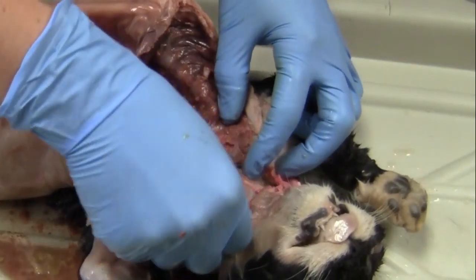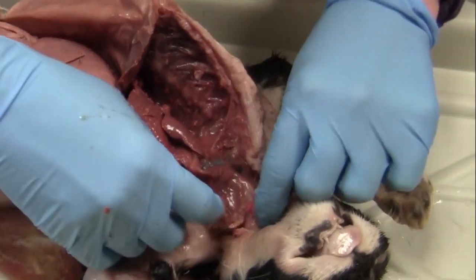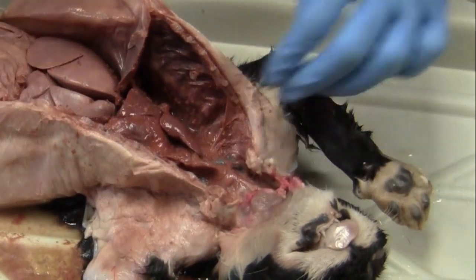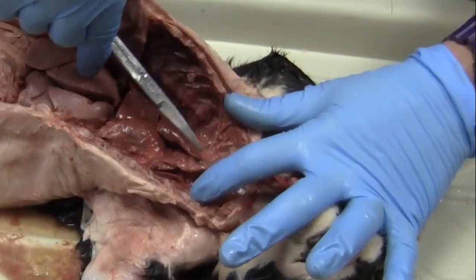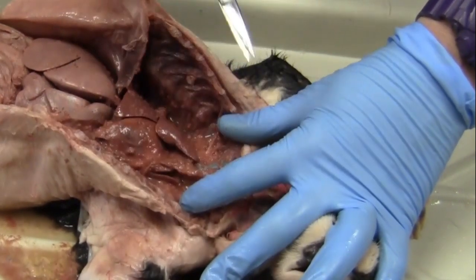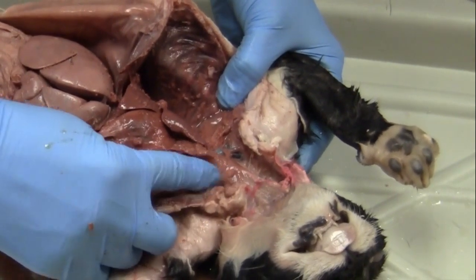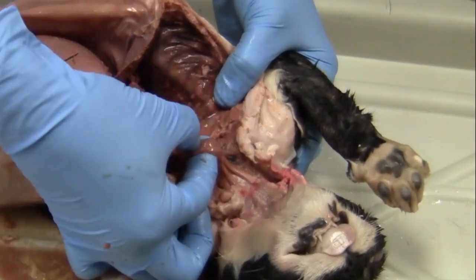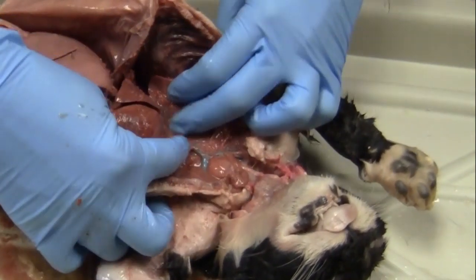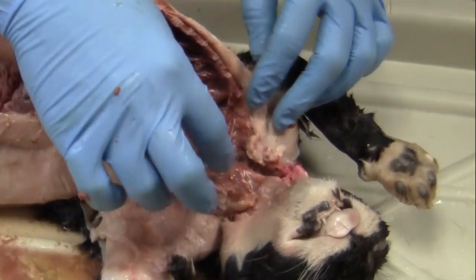Okay. So also when you're doing these, you can see I'm using a lot of my fingers for a lot of this stuff. You want to try and preserve as much of the tissue as you can. So using blunt dissection, taking your scissors and going in and then opening them up. So you're sticking your scissors in and then you're opening them up. Sticking them in, opening them up. Or I'm using my fingers a lot. So you can see that my fingers actually will help melt away a lot of this tissue. And that will help not destroy any of the structure. So here's a big, nice vein here for you. That's going to be your cranial vena cava.